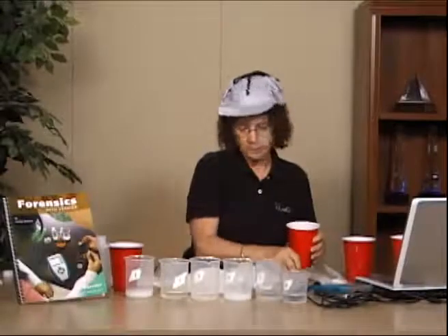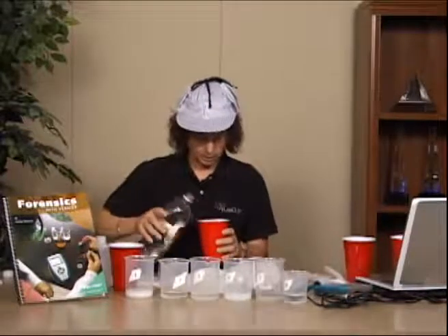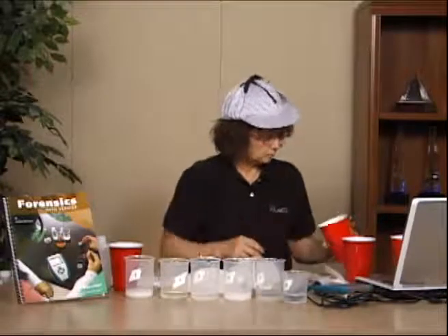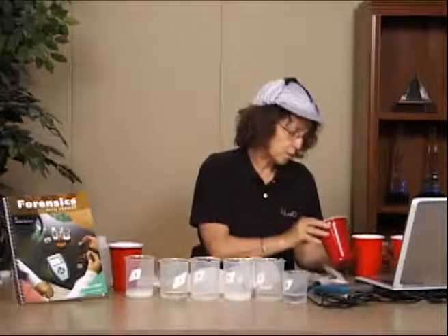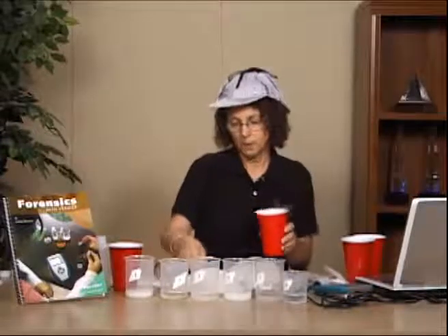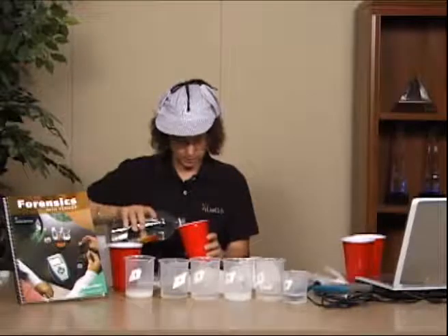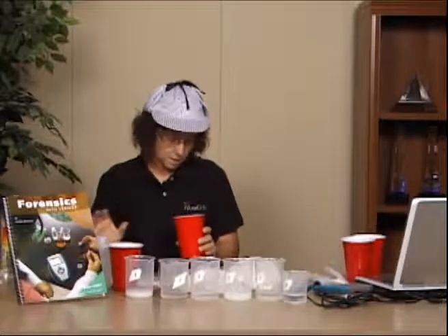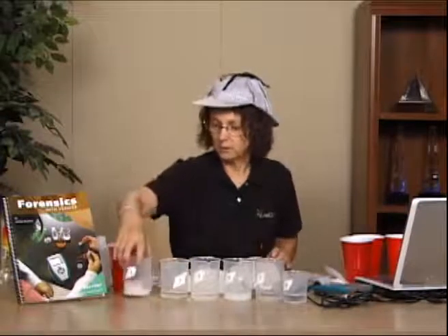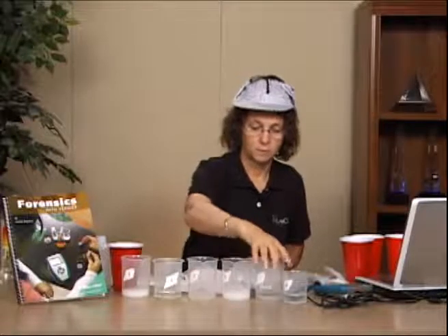The other nice thing about this lab is that it uses very common household things. And I'm getting lots of bubbles with this particular one, which happens to be number 4. With the other one, I didn't get quite so many bubbles, but I got bubbles. And again, I'm going to do it with each of my samples, and I'm going to do it with my unknown and see what happens. And in this case, nothing at all happened. And so I'm recording all of that data right down on my log table. And again, I just keep swirling.